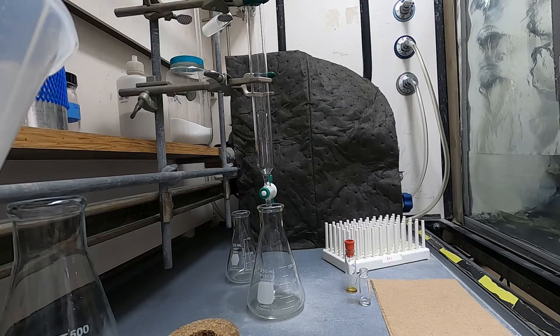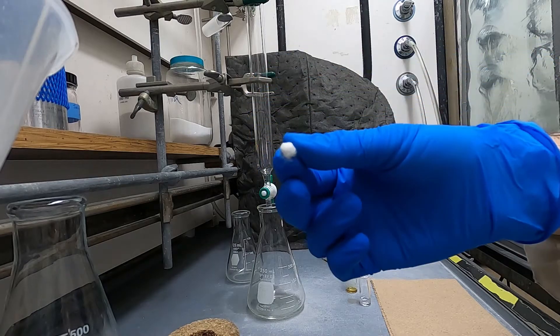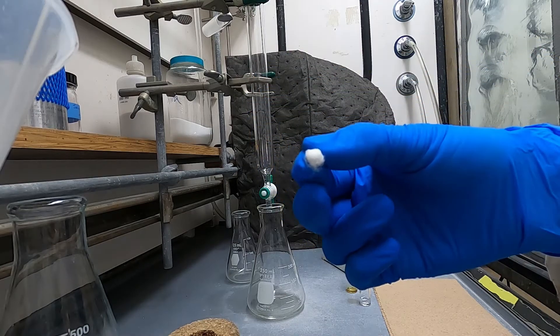Hello Yun Group and welcome to the training video for how to run a column. First off, you put some cotton in the bottom.